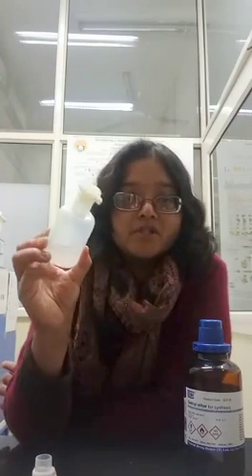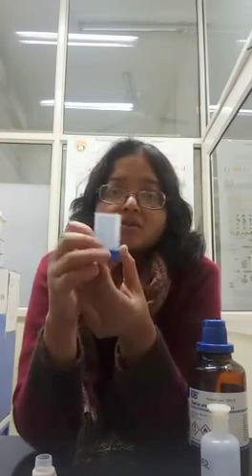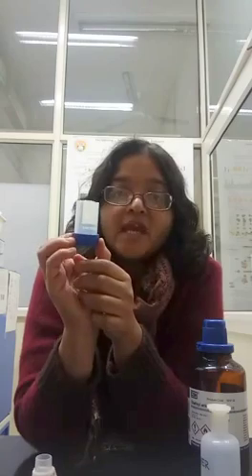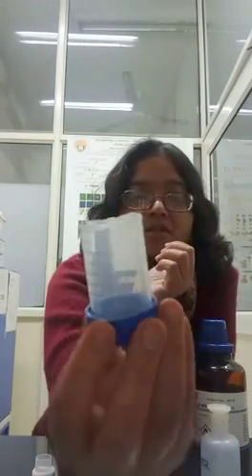The idea is simple. We have diethyl ether, allocated in this small bottle which you can use to drip small drops out. To make the anesthetization chamber, we have used this plastic tube — it is a 50 ml Falcon tube — and we just cut it just above the 30 ml mark, which is good enough.